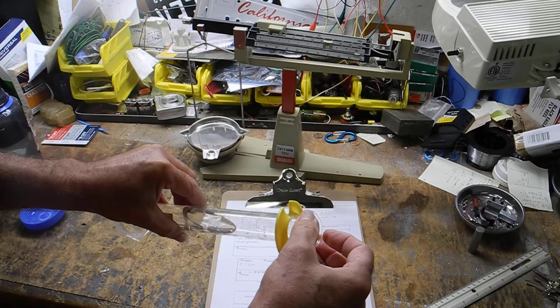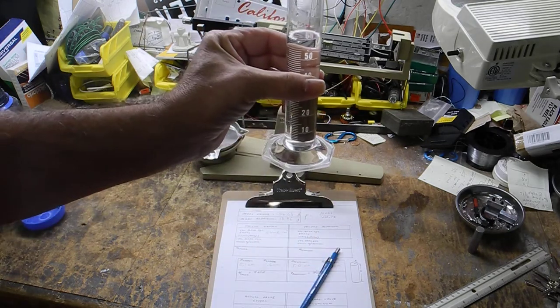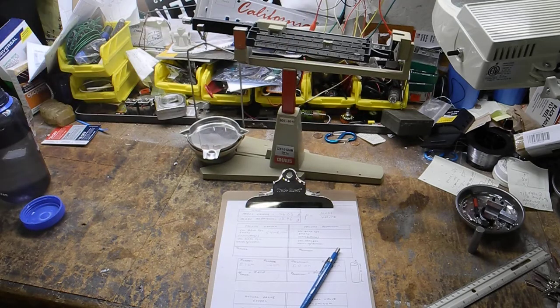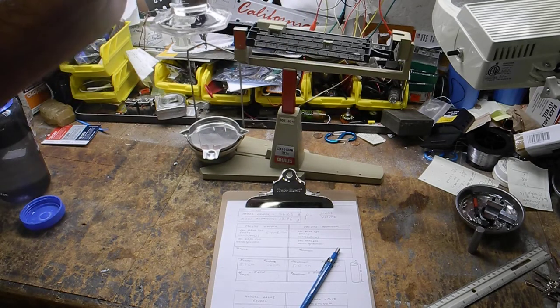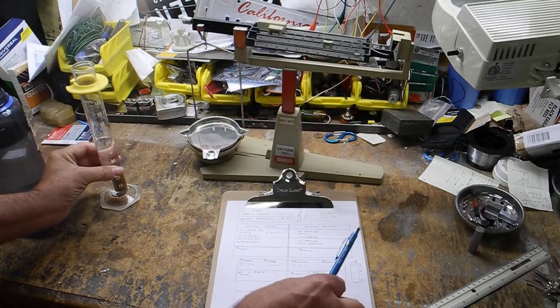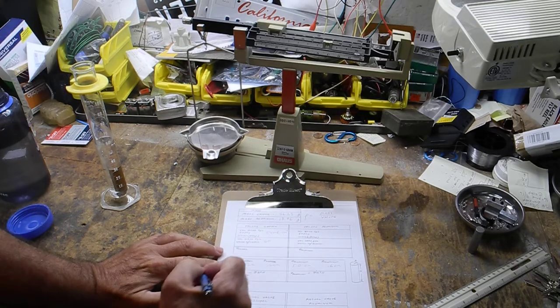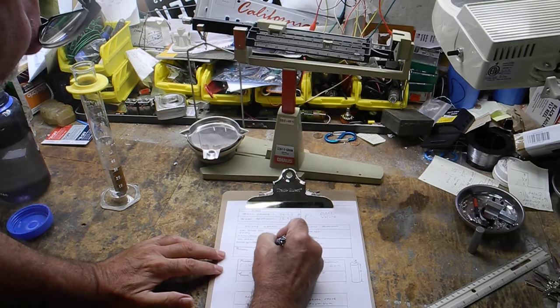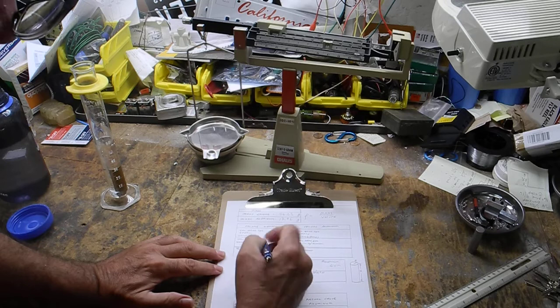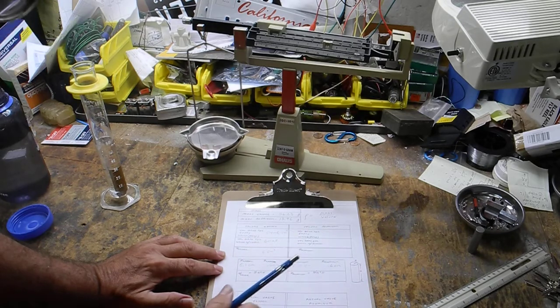Hear it? Hear how hard that sounded? Imagine if I just dropped it in. Okay, so now you can see it's pretty close to 60. Let me read that. Get in a light here so I can see what I got here. And it is 60. That's kind of nice. Okay, so 60. Shoot, we could do this in our head. 60 minus 54, that's 6 centimeters cubed. So that's the volume of the copper one.